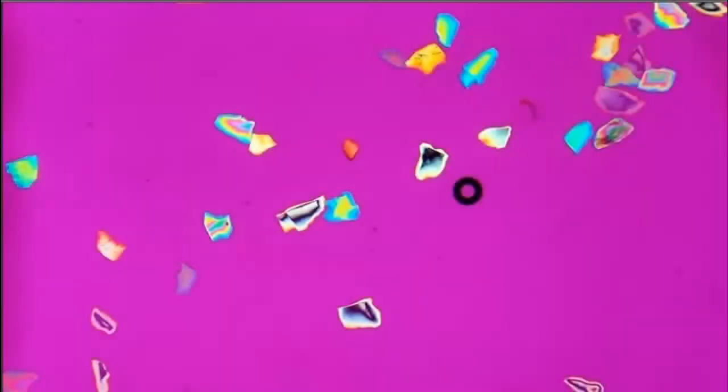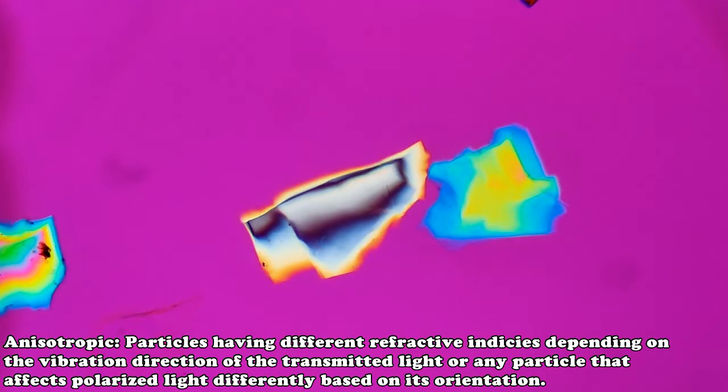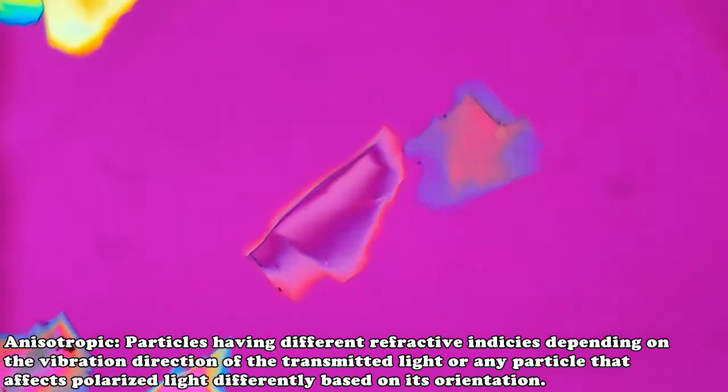Here we have quartz grains under the polarized light microscope with the first order red accessory plate and cross polars in place. Let's take a look at a couple fairly typical grains. You can see the mineral's anisotropic. Basically, it'll change from blue to yellow color as you rotate it around on the stage. This change in color is due to the light waves speeding up or slowing down as they pass through the particle. You'll also see that these particles have knife edges.